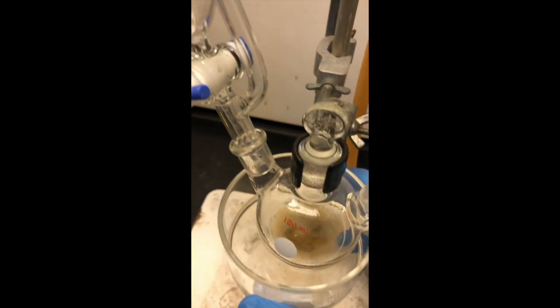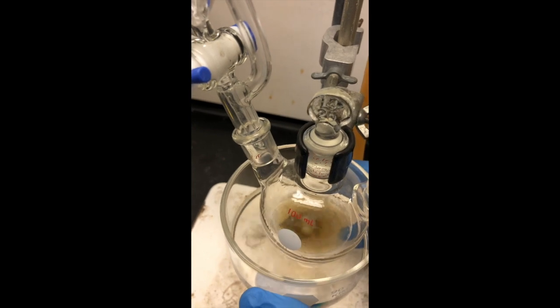And then the final step is to dilute it even further with a little more ether, and we're going to then have a long reflux period.